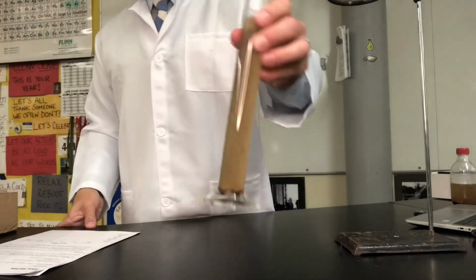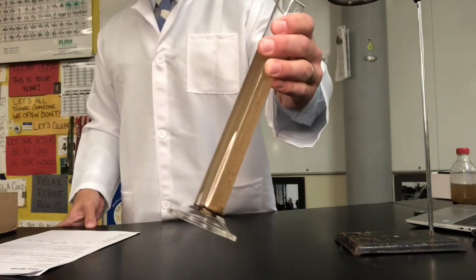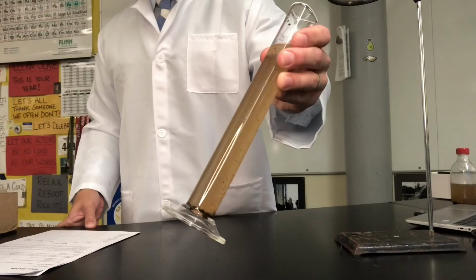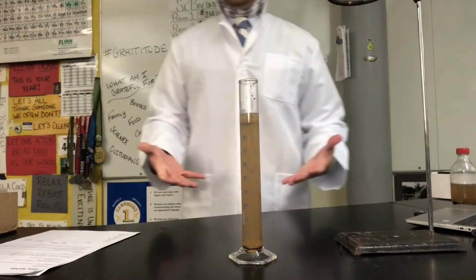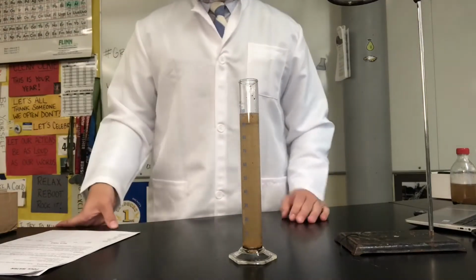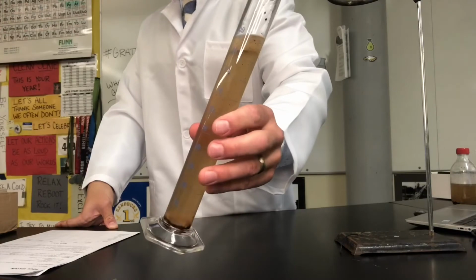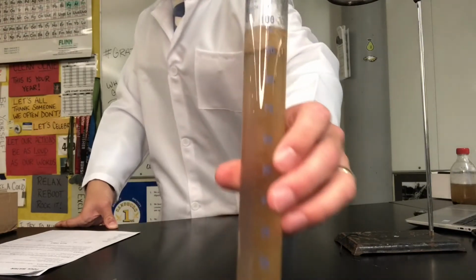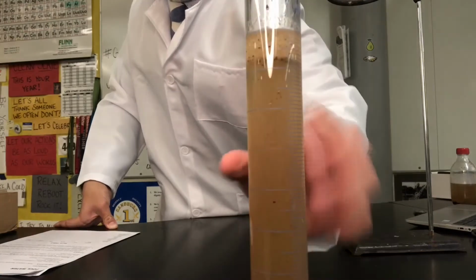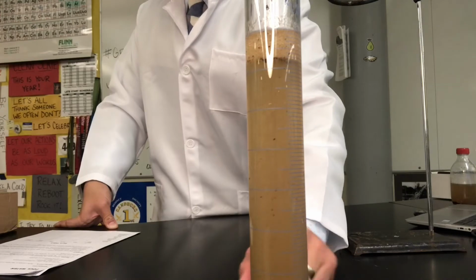Now, the color, you can take a look at it, but it looks like a brownish, beige, yellow kind of color to it. Definitely dirty. Now, when we're making observations, we want to make sure we write it in a way that people understand. So I would definitely say that this is a light beige or a yellow in there. Okay, so go ahead and write that down. As far as clarity, take a look. It's not very clear, right? It's cloudy. So let's write that down as cloudy.